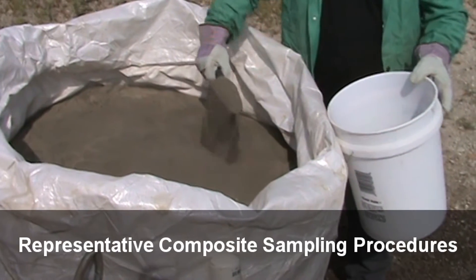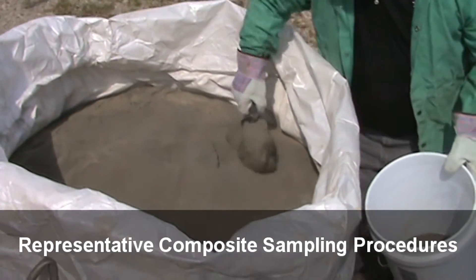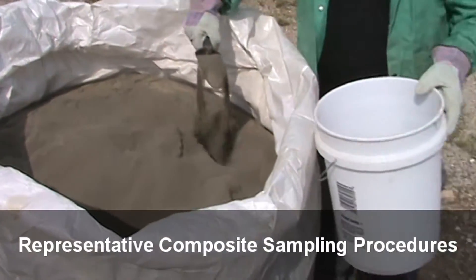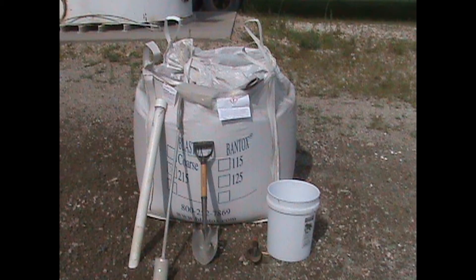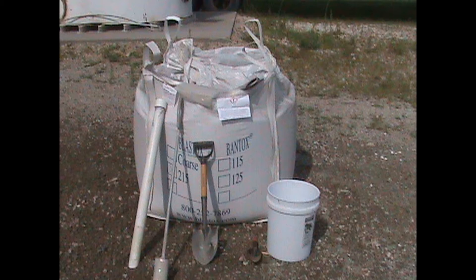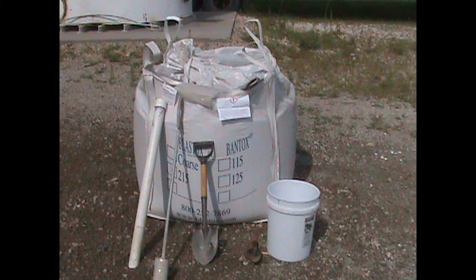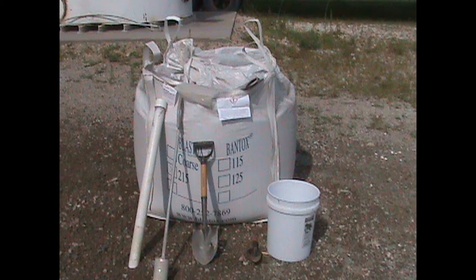No matter the size of the waste pile, it is important to ensure that a representative sample of the waste can be collected for testing. Shown are some of the implements that can be used for sampling. Any tool can be used to dig into the waste pile and collect a small portion for testing. Best results are when the implement is able to pierce down into the waste and collect all levels of a pile, top to bottom.